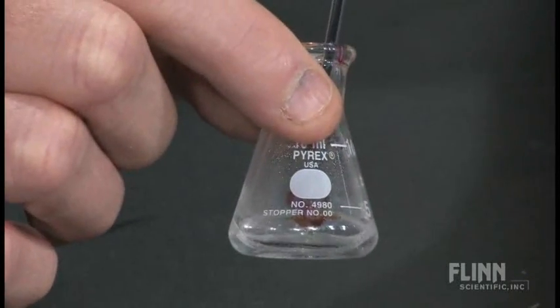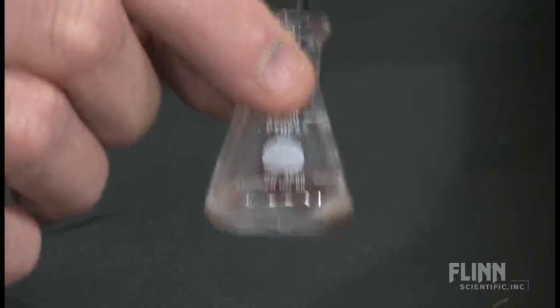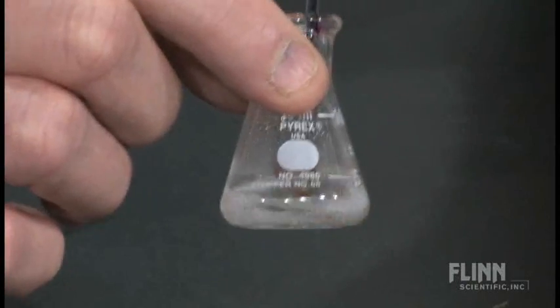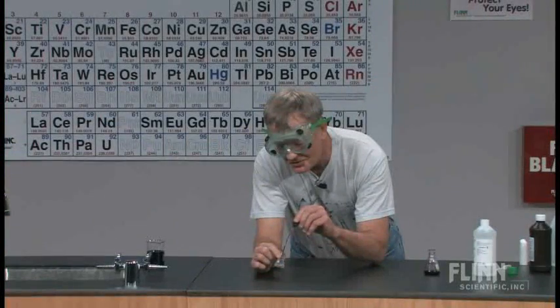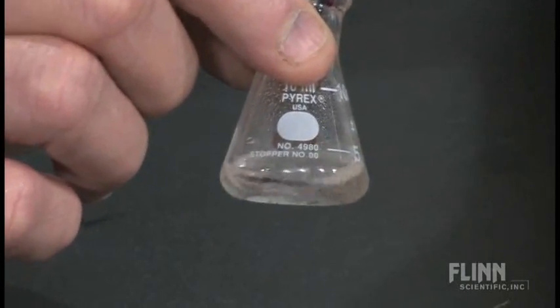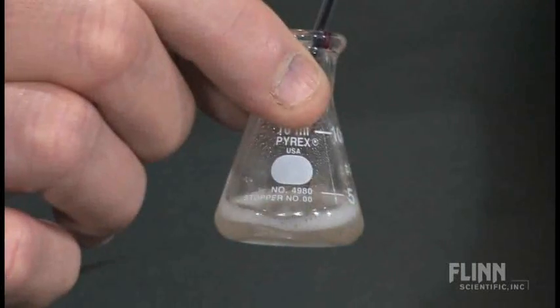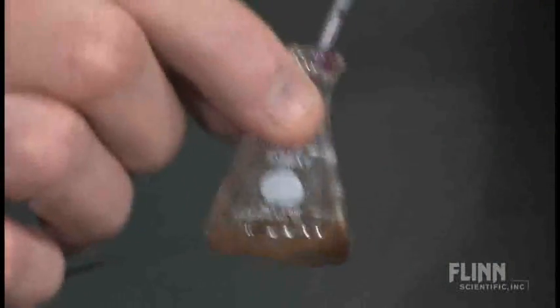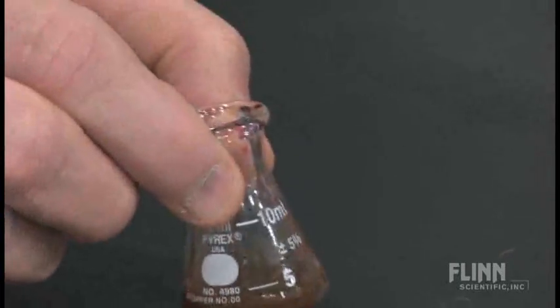Still generating a pretty fair amount of oxygen when that peroxide decomposes, but you'll notice that the color is lasting a little longer each time. I'm getting closer and closer to that end point. The end point by the way is a pinkish color. Lasting longer, getting close, getting closer. Whoa whoa whoa, I think I hit it, I think I really hit it. Okay, and there's my end point. I went a little bit past it because I was just going fast for the sake of demonstration.